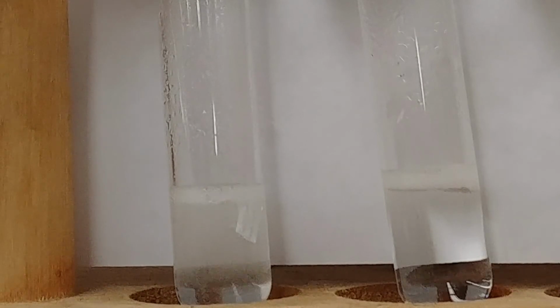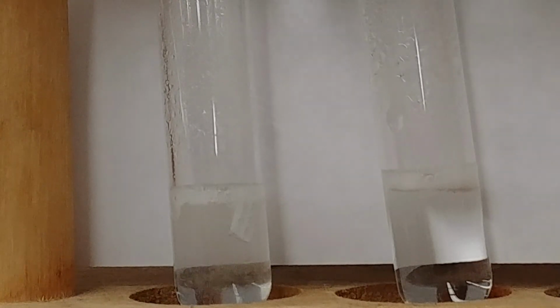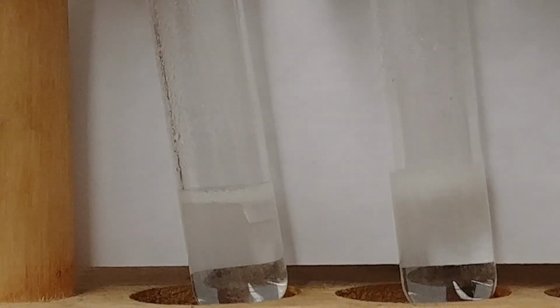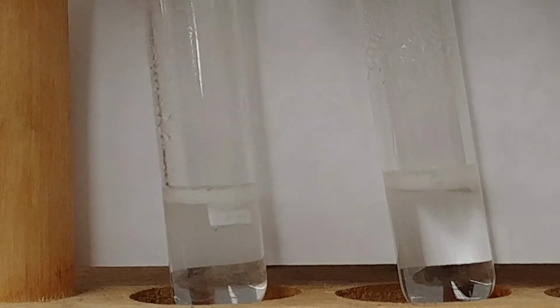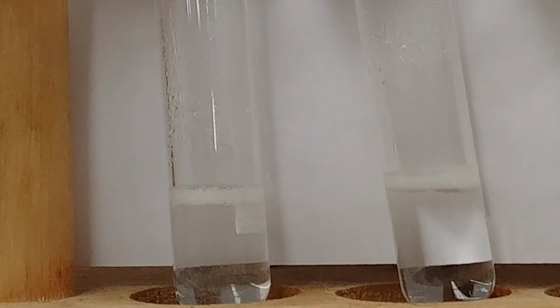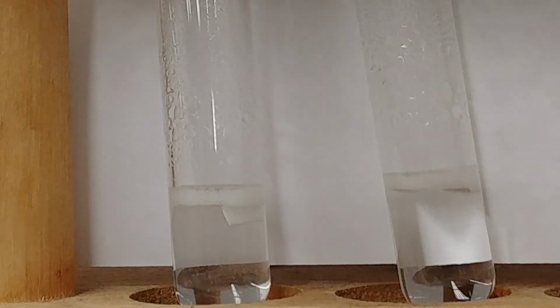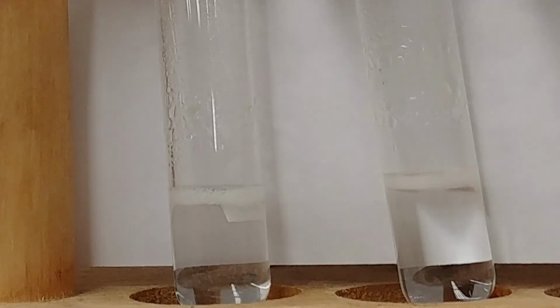The greater the difference in temperature, the easier it is to see the difference in their rate of reaction. As we let this sit for too long, those temperatures start to get closer together. So we start to see the rates sort of reach similar rates. So hopefully that's enough for you to take your observations on the comparison of cold temperature reactions versus hot temperature reactions.